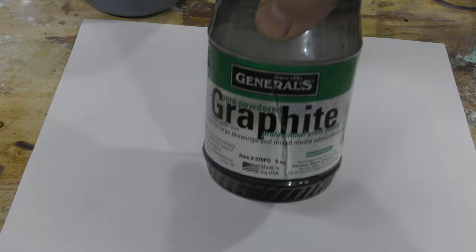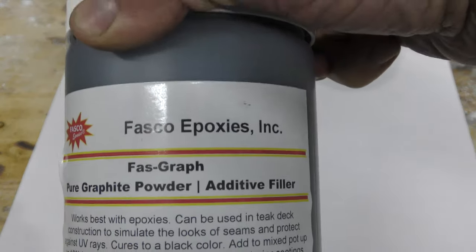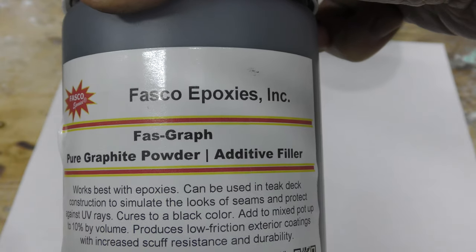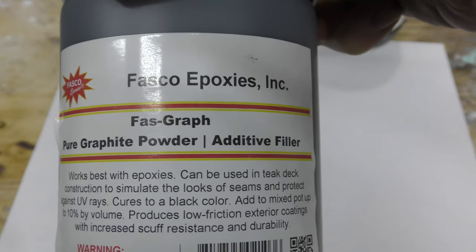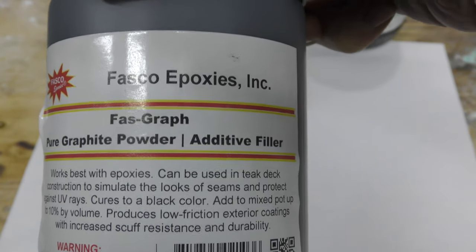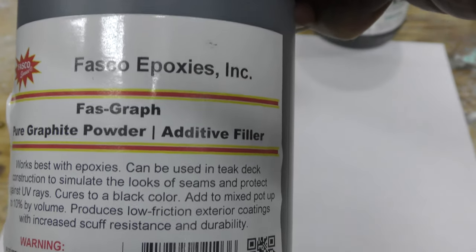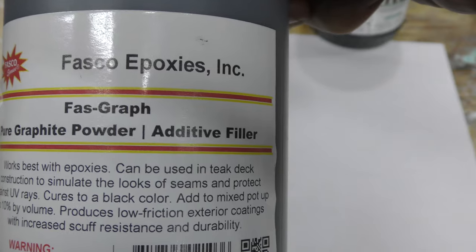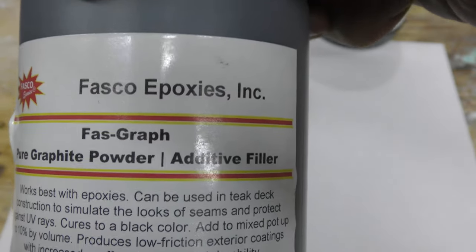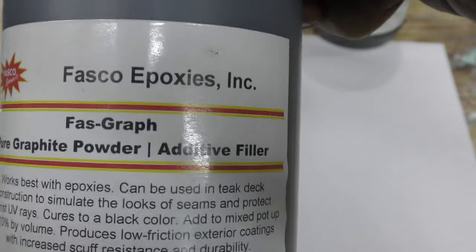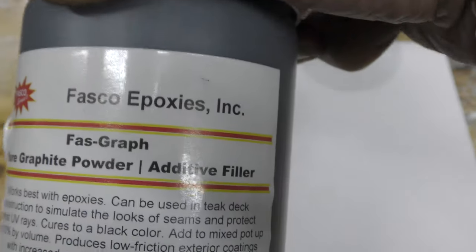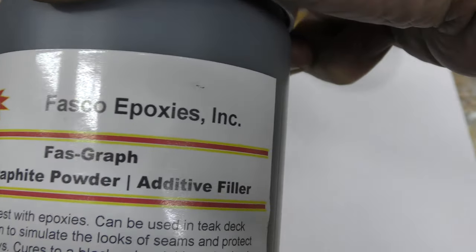Okay, today we're going to be looking at testing graphite. I have bought this product before and the purity levels of it have dropped, so I'm going to show you how to test the purity levels of graphite.